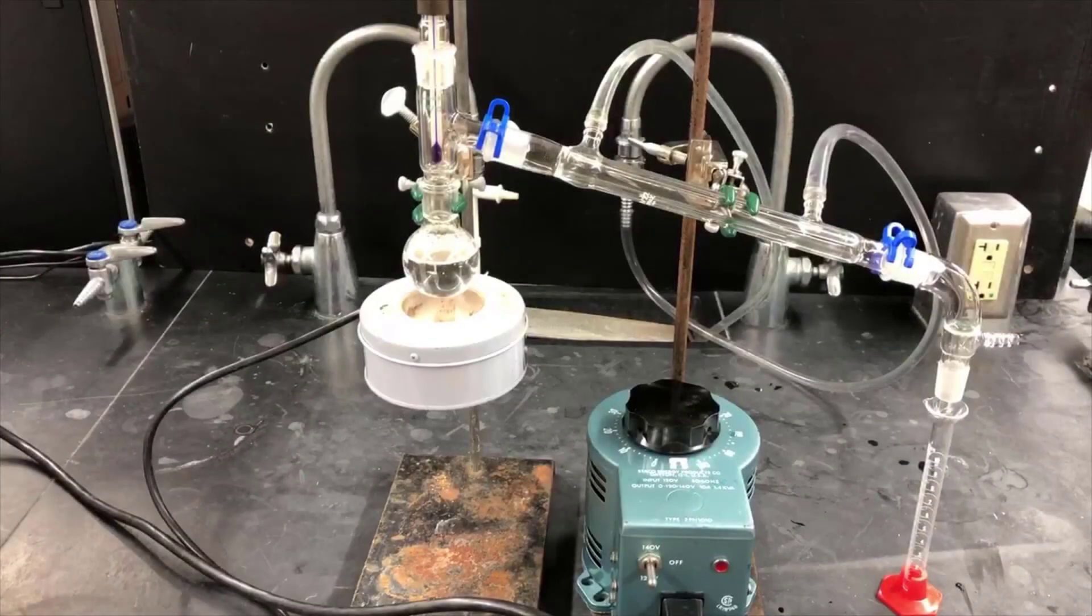Now we're ready to go on and isolate the product using steam distillation. Steam distillation was covered extensively in a previous video, so you should definitely check that out if you haven't already. In this video, I'm going to go over the major components of the distillation apparatus and just talk about what's different between this apparatus and the previous setup.